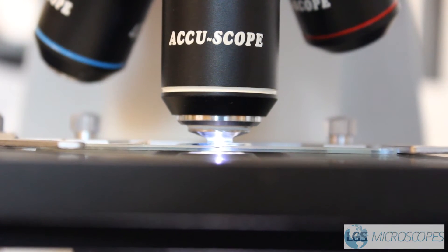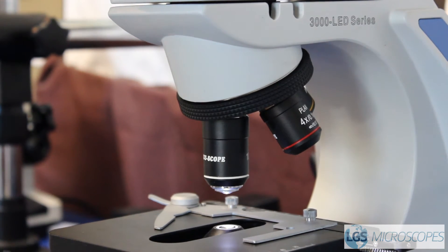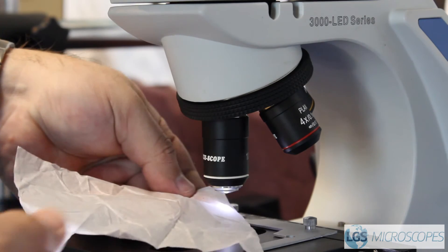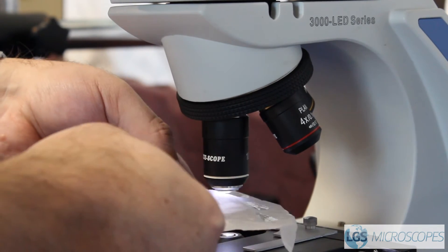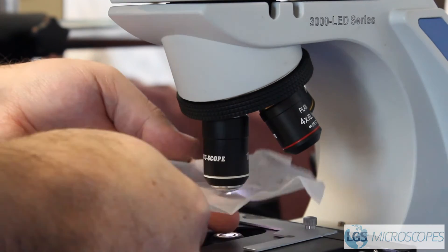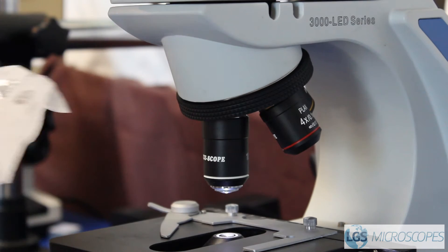So now what we're going to do is pull down our stage, remove our slide, and you can take some lens paper and just dab the 100x objective to clean it off. You just keep dabbing until no more oil is coming off. You don't want to wipe — just dab gently until there's no more coming off. If you ever need to come back and review how to use immersion oil properly or train a new recruit, we'll have a separate video that just goes over immersion oil use.